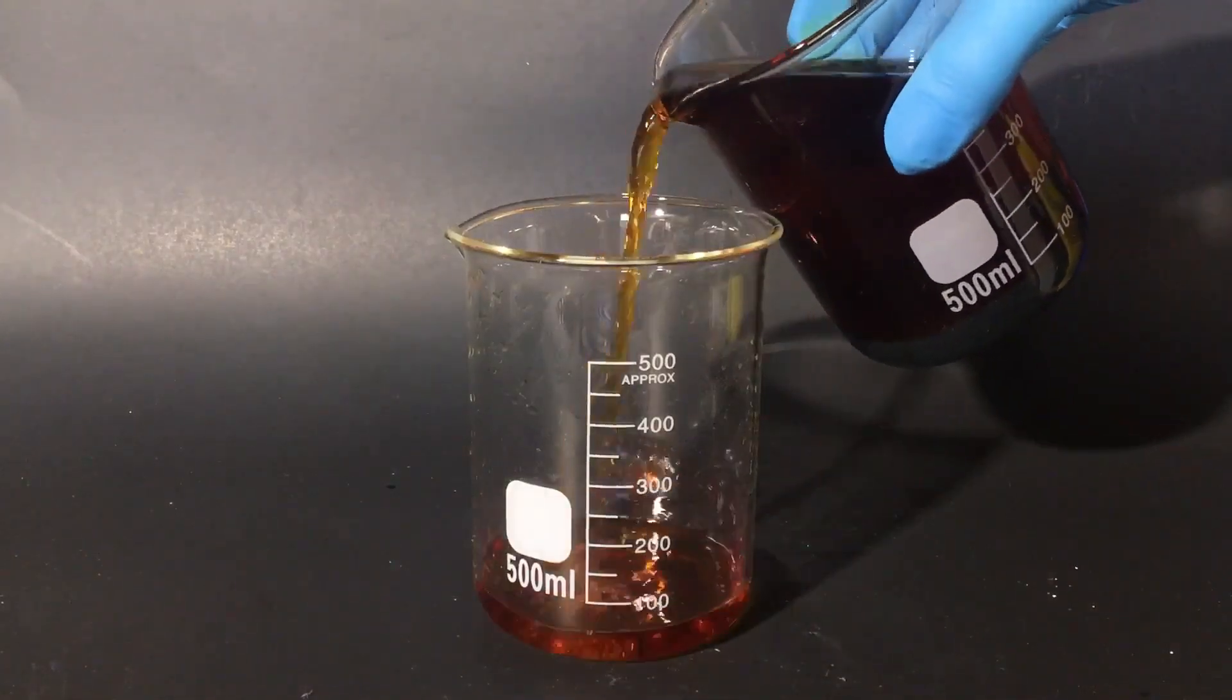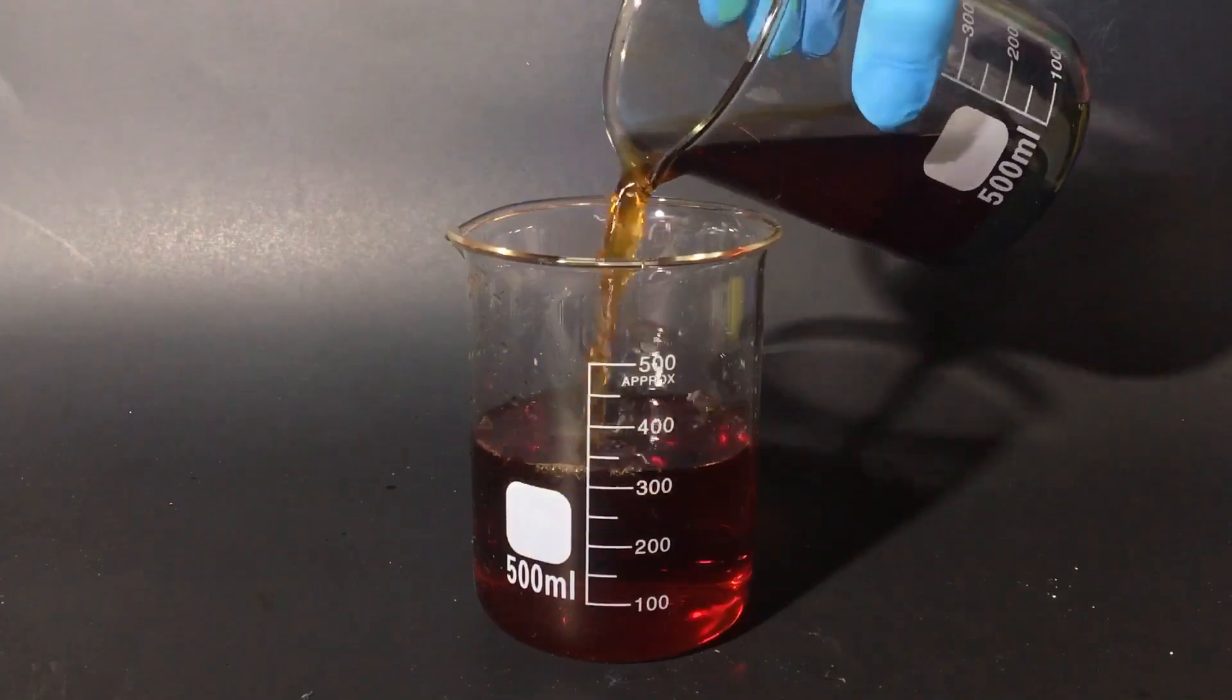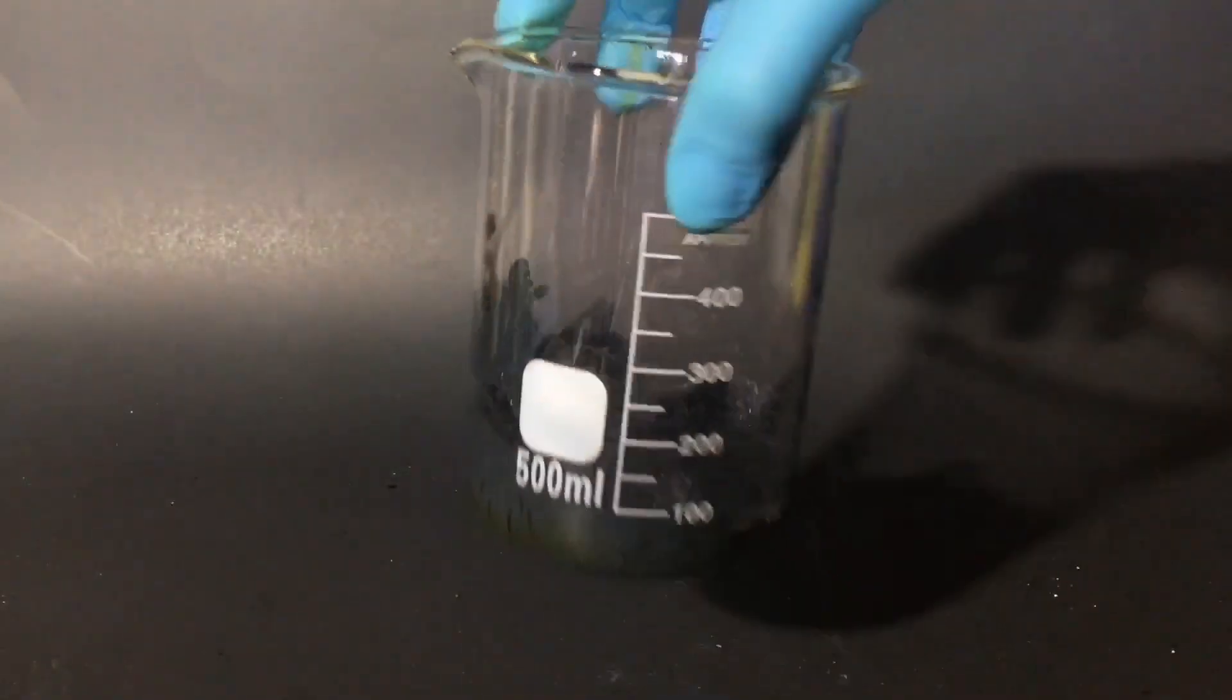Now, all I need to do is pour out the liquid layer at the top, and all of the wet iodine should stay at the bottom.